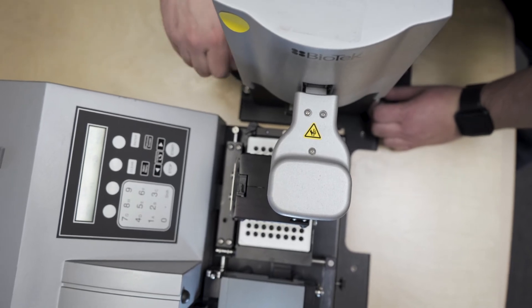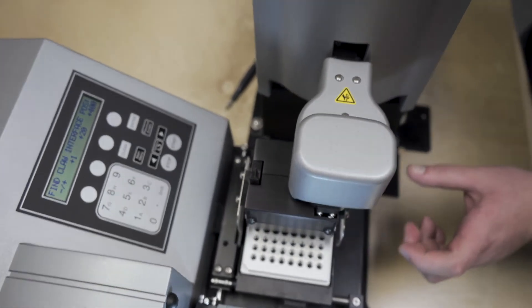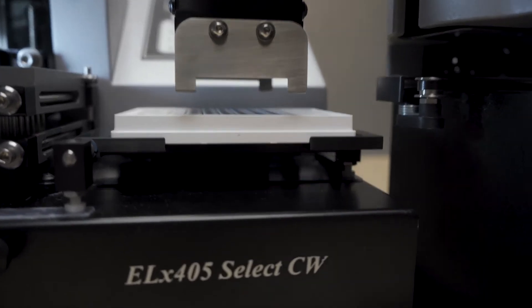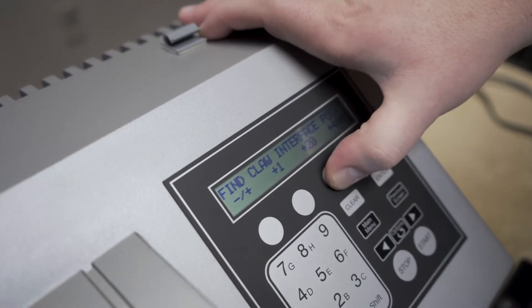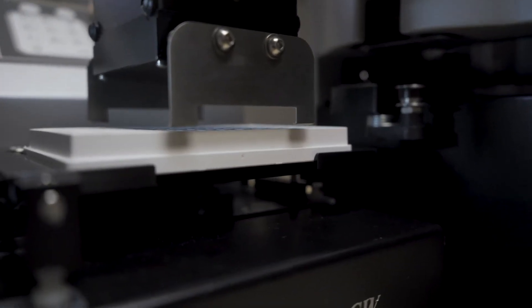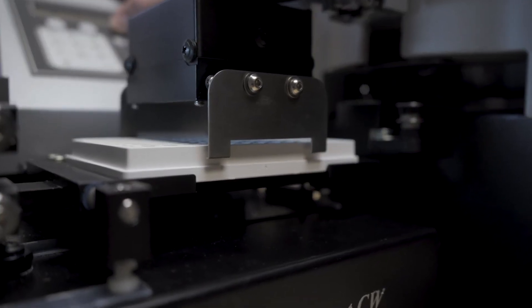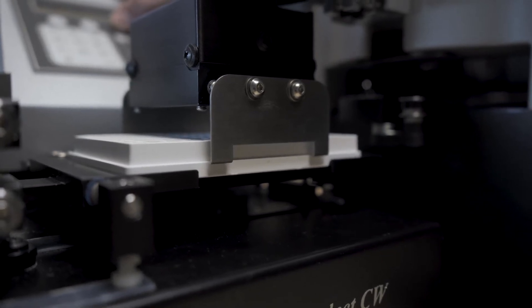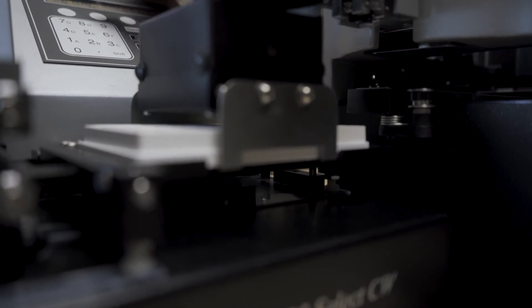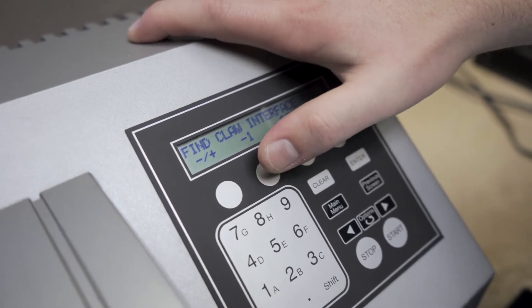Try to fine tune the position by physically moving the stacker so that the gripper has even spacing on both sides, and is more or less centered with the grooves on either side of the plate carrier. Once you're confident in that position, continue stepping down in 20s. Our goal here is to leave about a millimeter of space underneath the bottom of the plate, so that the gripper has a little bit of room for error. If you feel you've gone too far, simply change to the negative option and step up in 1 until you've reached a good position for gripping the plate.